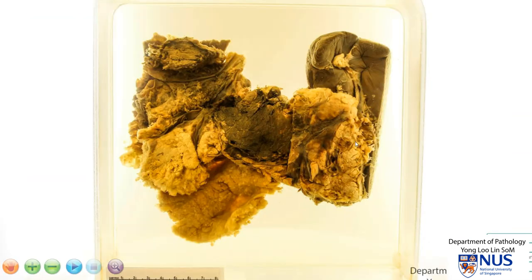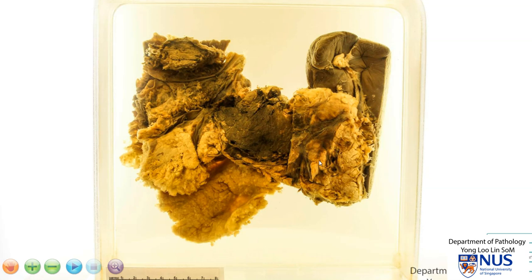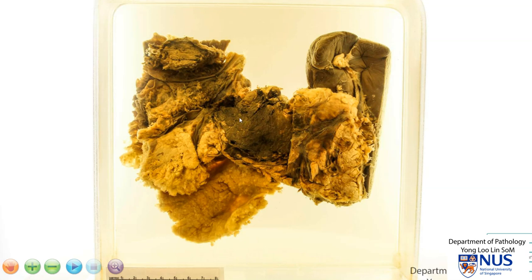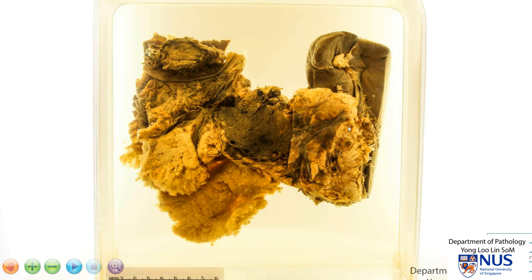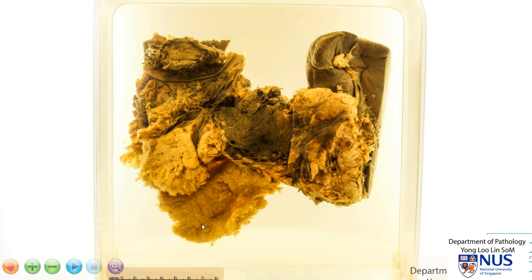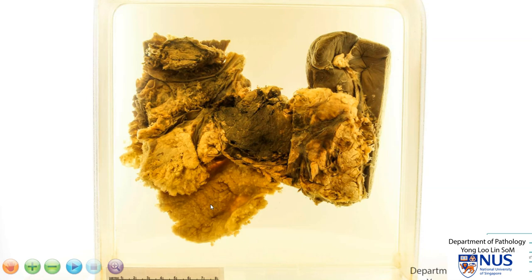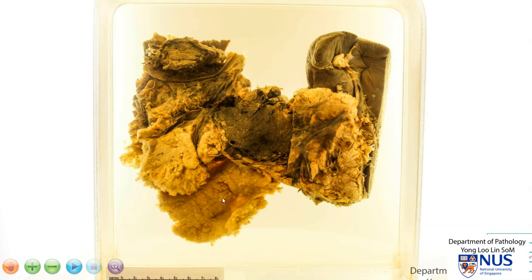In summary, this is an example of acute hemorrhagic pancreatitis. There are several features we can see. The pancreas itself is swollen or edematous and it is markedly hemorrhagic, with these blackish areas. The parenchyma also shows extensive necrosis. Around the pancreatic tissue, the peripancreatic fat shows chalky deposits of soaps, and this is because of release of fatty acids and combination with calcium.